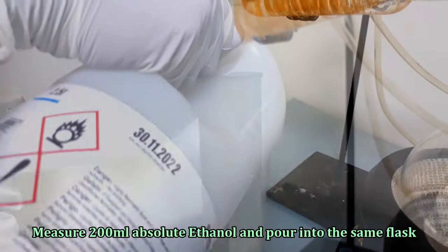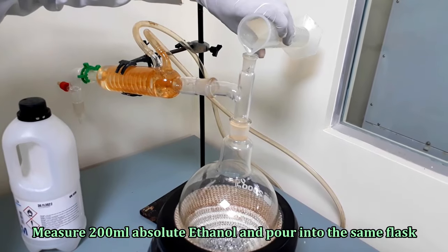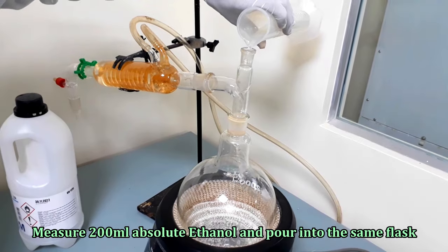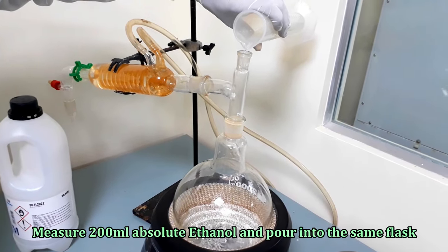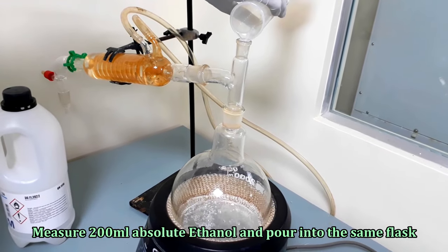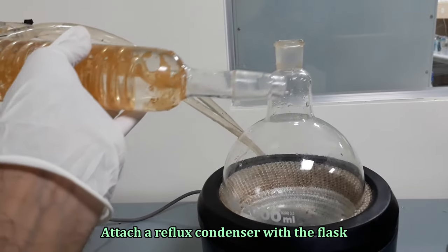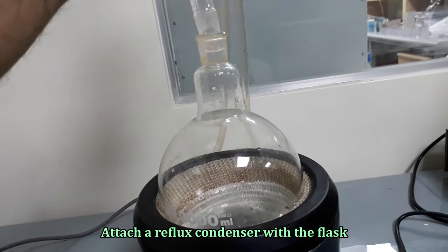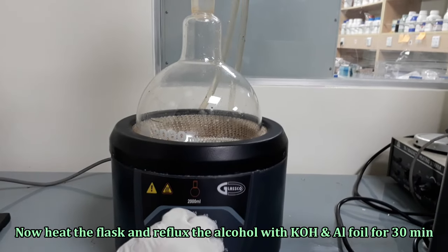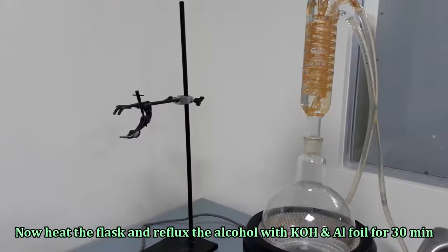Now measure 200 ml absolute ethanol and pour into the same distillation flask. Attach the reflux condenser with the flask. Heat the flask and reflux the alcohol with potassium hydroxide and aluminum foil for 30 minutes.